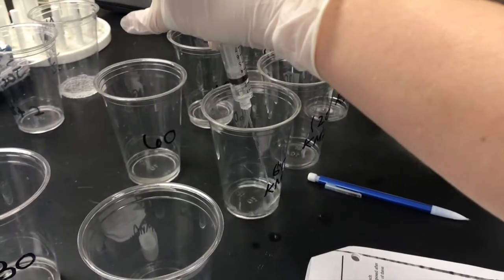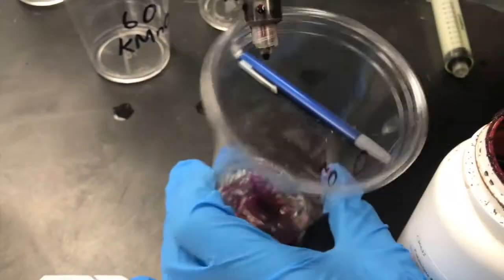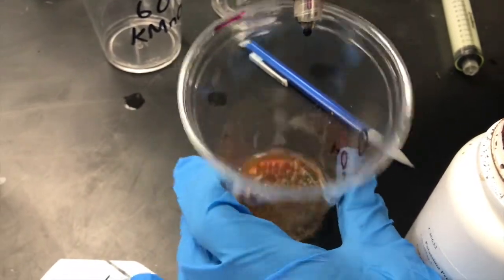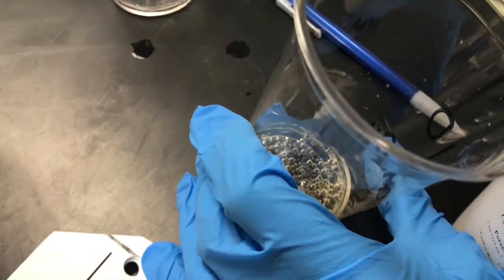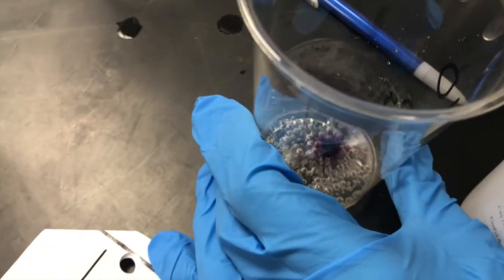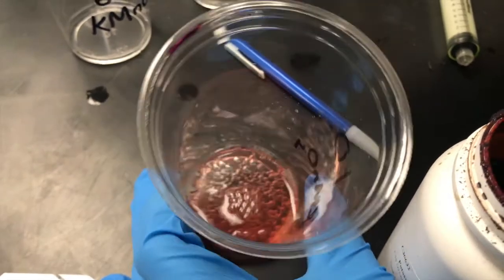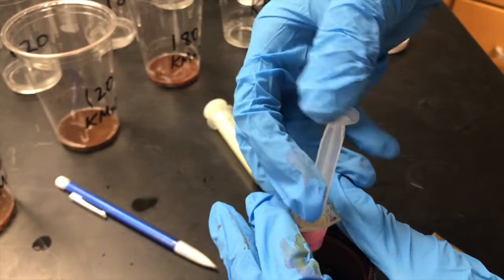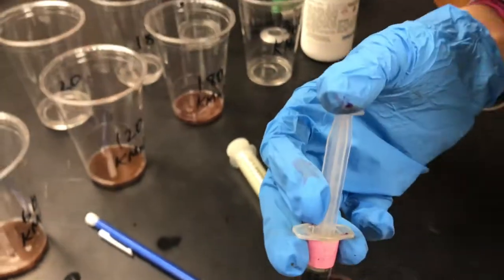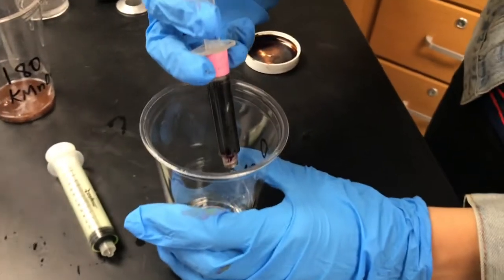To analyze the effect that time had on enzymatic activity, we used a method of titration, a method used to determine the unknown concentration of a solution. In this case, we assayed for the amount of H2O2 after each time interval, separating 5 milliliters of each solution and adding drops of potassium permanganate until the color of each solution turned to a persistent brown or pink color. To tie our data together, we compared the amount of H2O2 used in each cup to draw our conclusions.